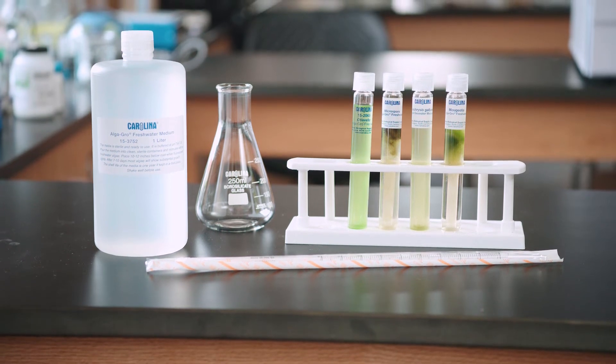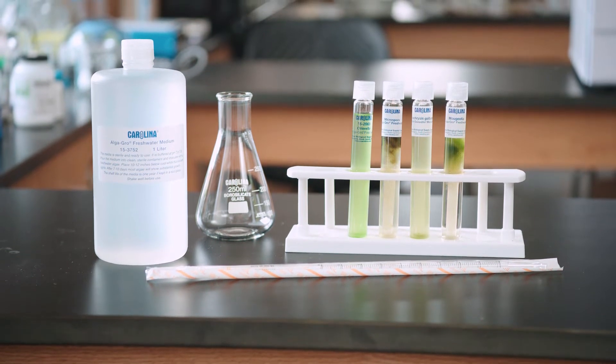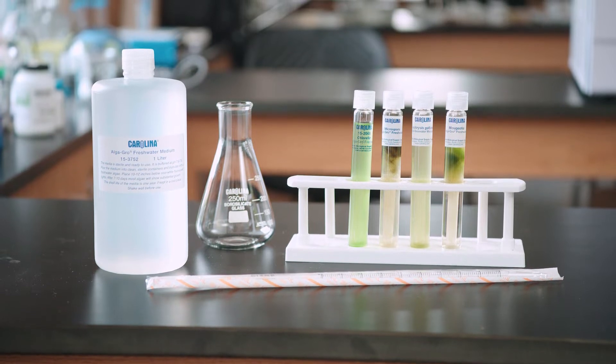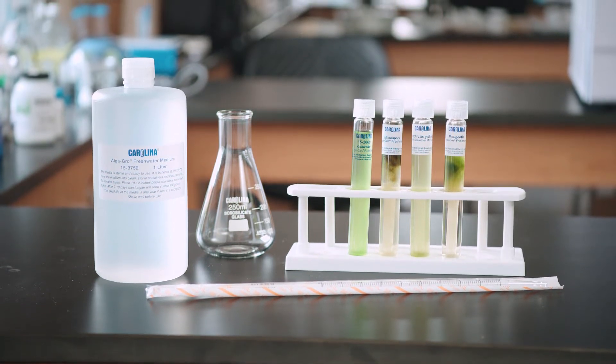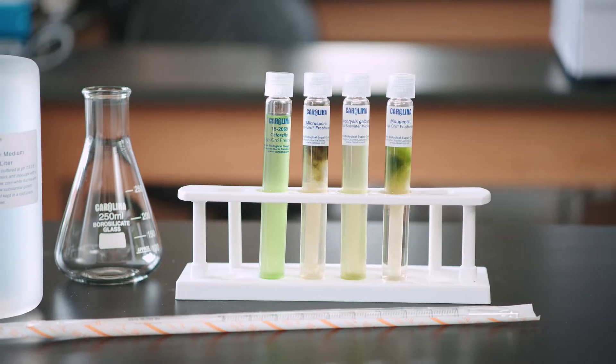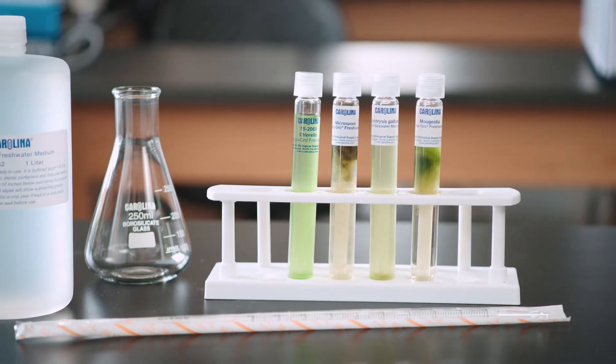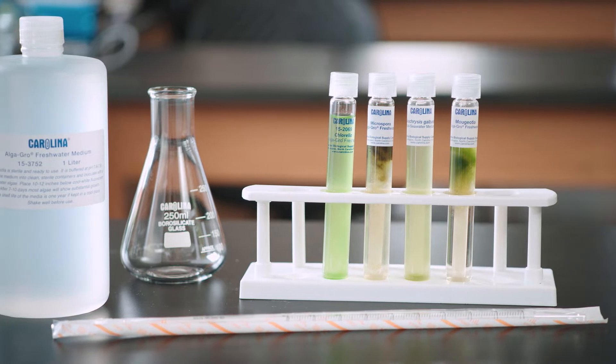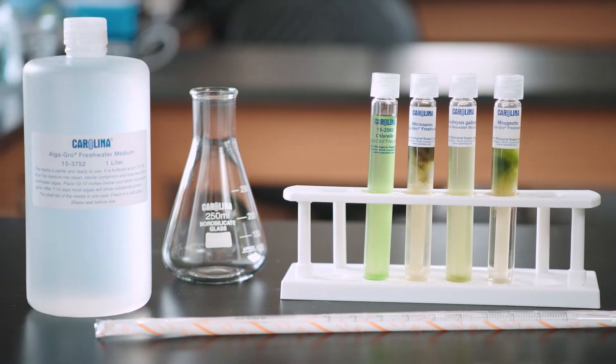Carolina's unialgal cultures are maintained by our experts to be alive whenever you need them for your lab. Our wide selection can be used to showcase the variety of algae or examine different natural phenomena. This video will help you maintain Carolina's algal cultures in your lab.